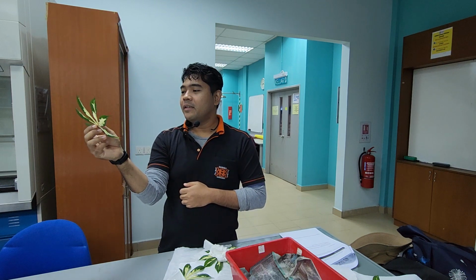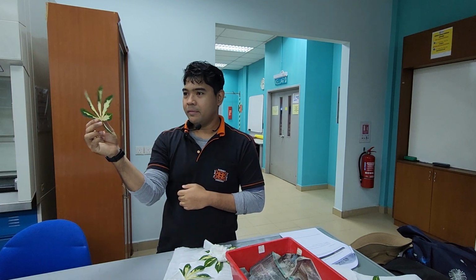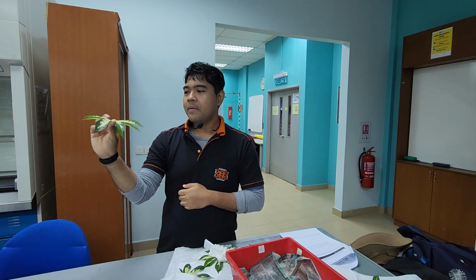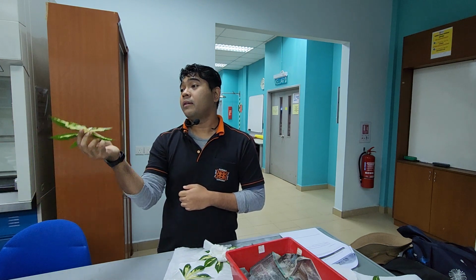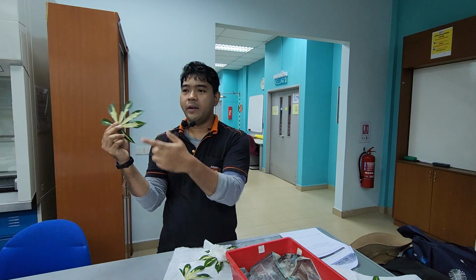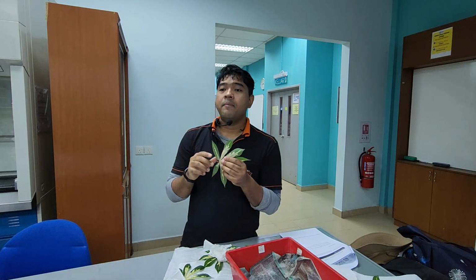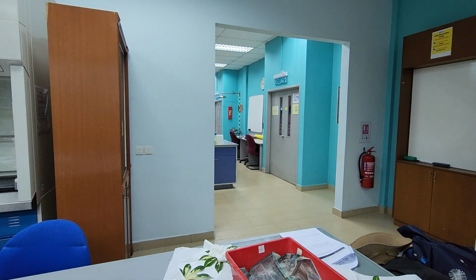So the common and vernacular name for it is ubi bunga. Yeah. So maybe it's the same Manihot esculenta that you know. Maybe the esculenta is variegatum because it's got variegation on it, right? So use that machine for your first determination of leaf area.